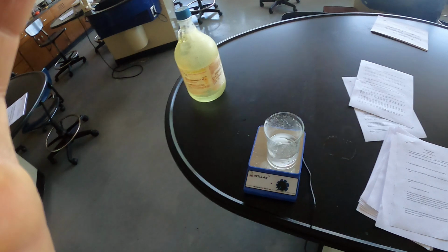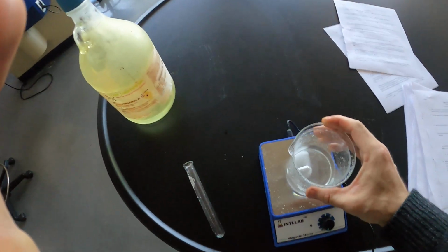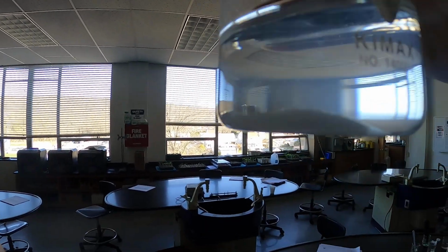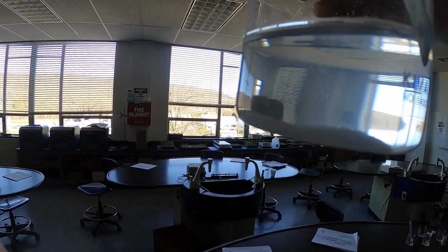So first up here, we have some saturated NaCl. And how do we know that this is saturated? We haven't talked about this a lot, but this has been stirring for 25 minutes and there's still solid at the bottom. Therefore, regardless of how much agitation I perform on this solution, there's a limit to how much NaCl can actually fit in this given volume of water.